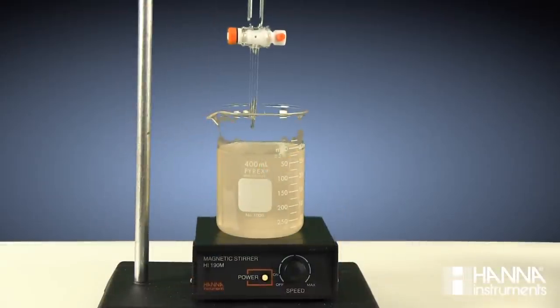For the determination of percent citric acid in orange juice today, we'll be using a 10 milliliter sample, which we obtained volumetrically and diluted with distilled water.